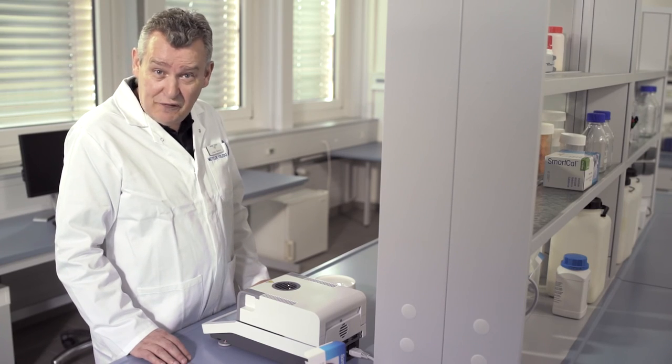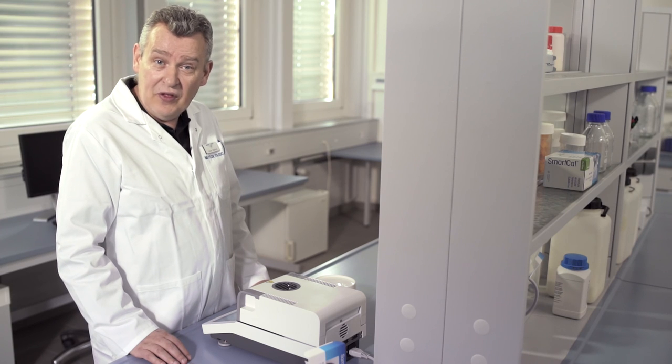Congratulations! You've just performed your first measurement on the HC103 Halogen Moisture Analyzer.